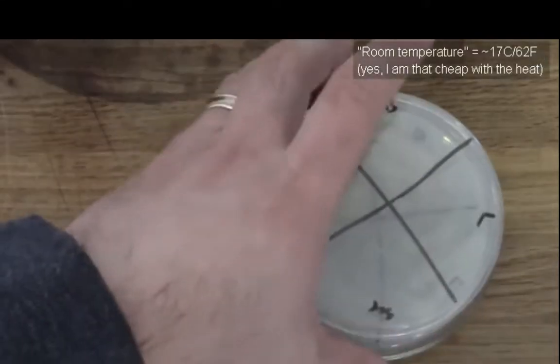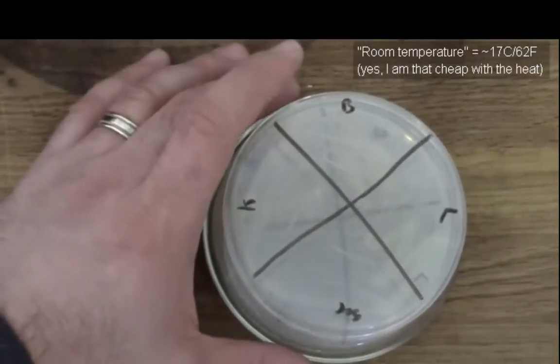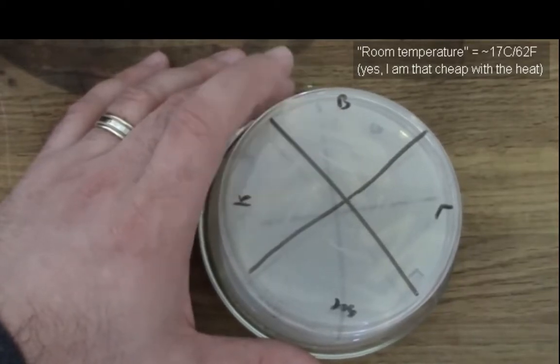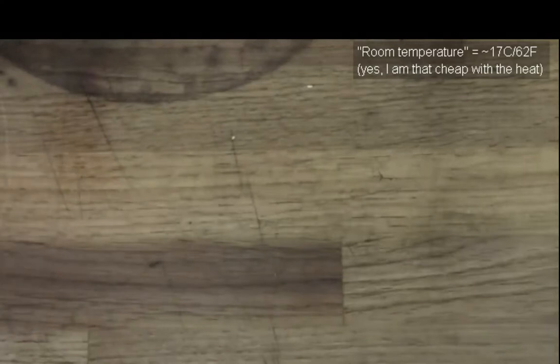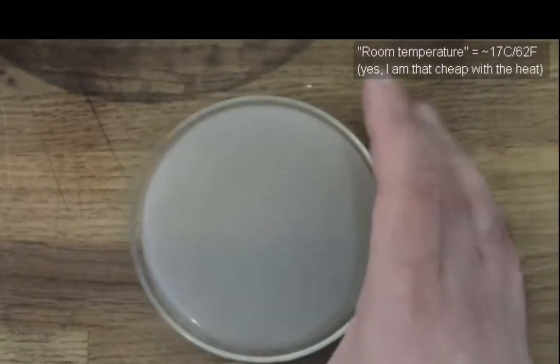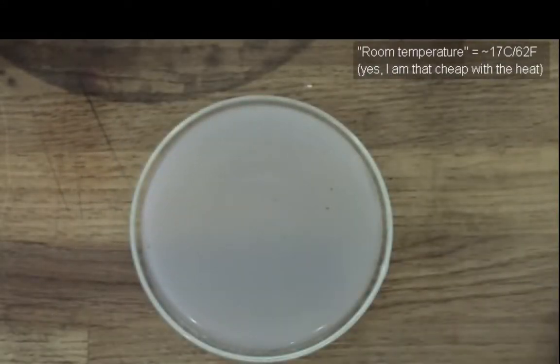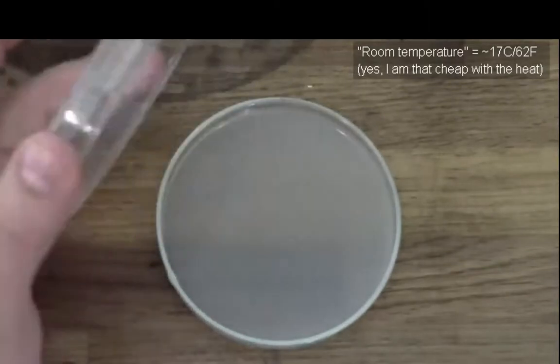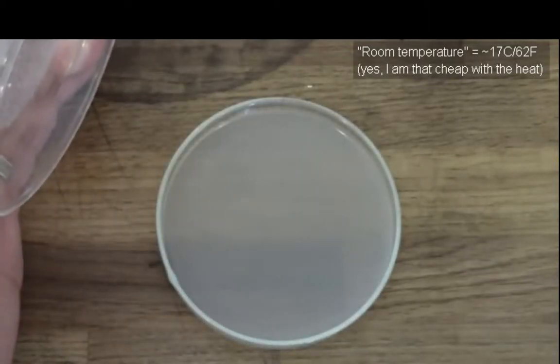So just lastly, I want to show you that these plates are in fact clean, even though I only boiled these medias for 5 minutes. Here is the other potato dextrose plate I made. You can see from the bottom there's clearly nothing growing, and even if I flip it over and pull the lid so you can get a good view, there's no growth on that plate.